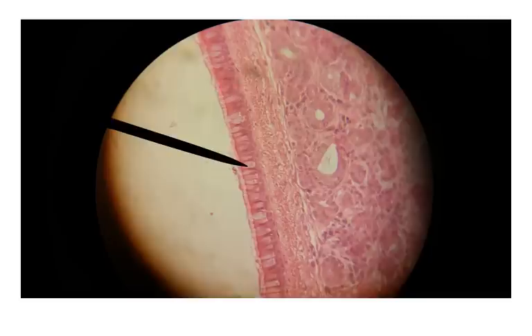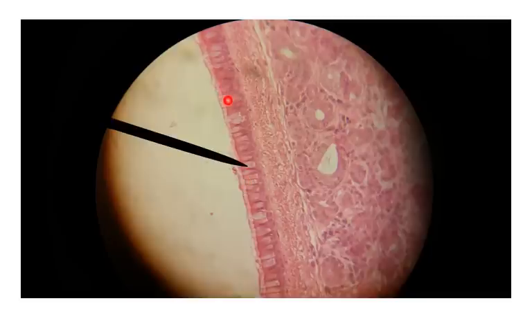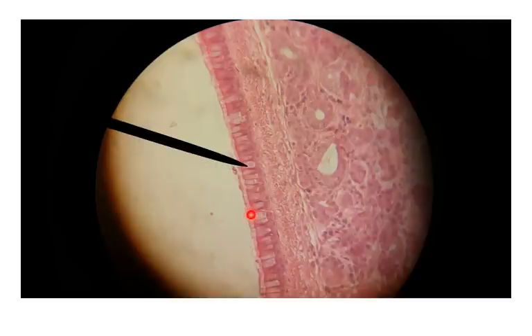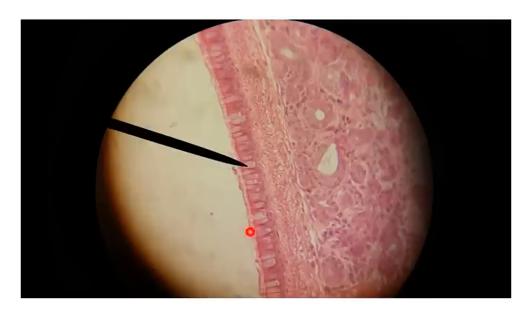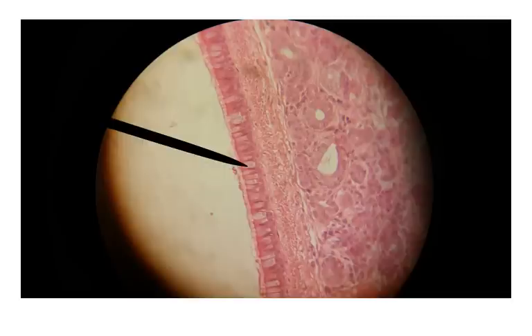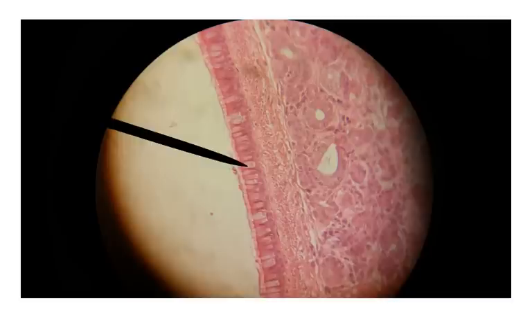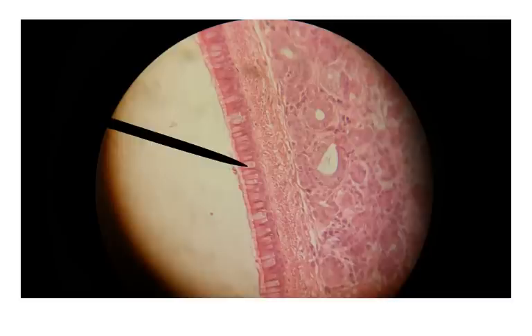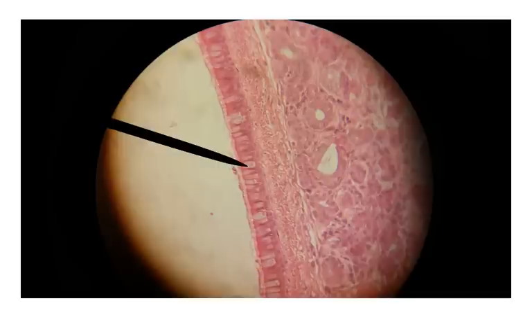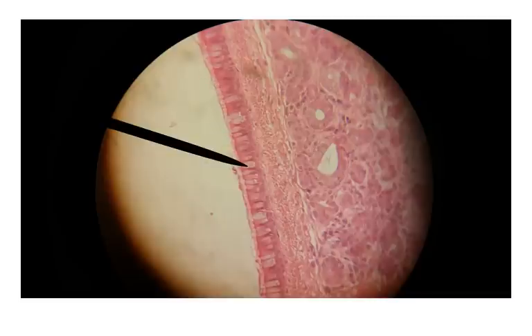Some cells scattered throughout this tissue layer look clear compared to the other darker purple cells. These clear cells are called goblet cells — they produce the mucus we're most concerned with. Goblet cells secrete mucus onto the inner surface of your trachea to lubricate it, but more importantly to catch dust particles. The cilia then have a beating motion that moves that mucus with trapped particles upward so you can cough it out.